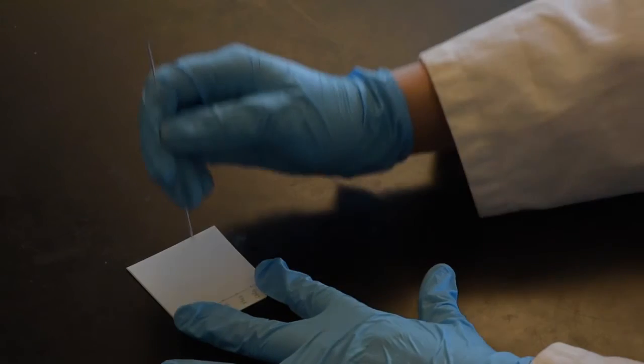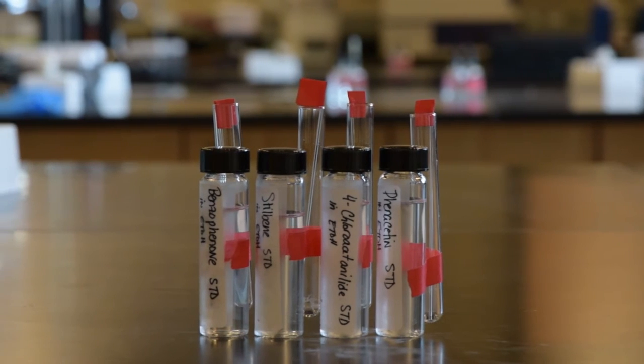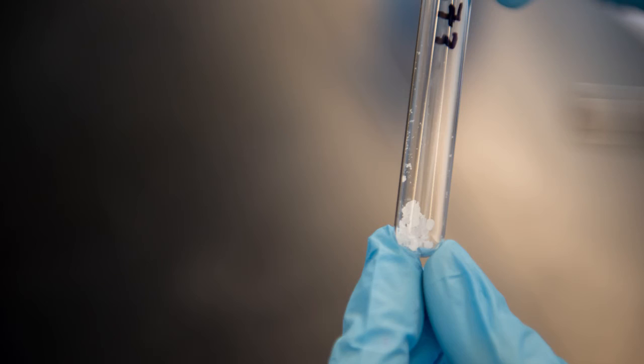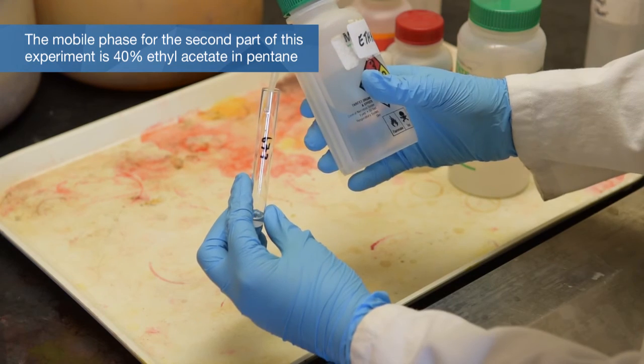Once you have an amount close to 1 millimeter, touch the end of the capillary tube to the labeled spot on the plate. Do this quickly and gently. The dot should have a diameter no more than 1 millimeter. For this portion of the lab, you will be spotting 4 standard complexes and the unknown sample assigned to you. If your sample is solid, you will first have to dissolve it into an appropriate solvent. An appropriate solvent for this experiment will be ethanol.